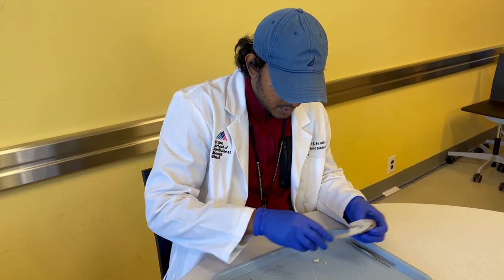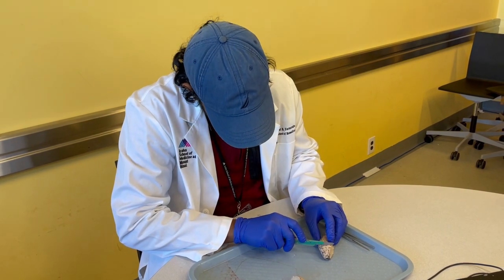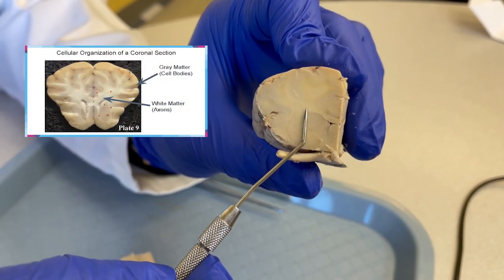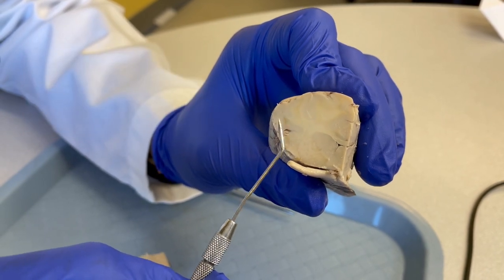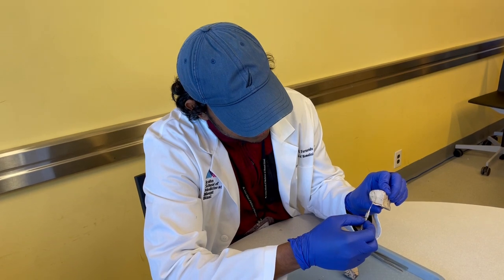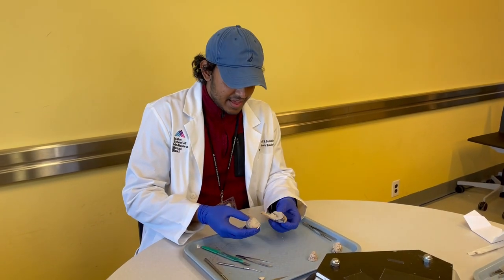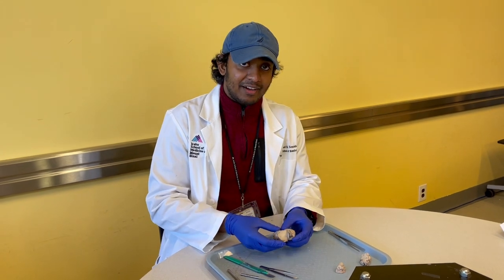The last section we will make is a coronal section to demonstrate that there are two types of matter in the brain. The first, lighter shaded, is white matter. Surrounding it is gray matter. The gray matter is composed of the cell bodies — the building blocks of neurons — and the white matter is composed of the axons projecting down toward their targets. That's essentially the main types of matter you can find in the brain. That is our tour through the sheep brain. Thank you so much for joining the 2021 Mount Sinai Annual Brain Fair, and please make sure to check out our other web content.